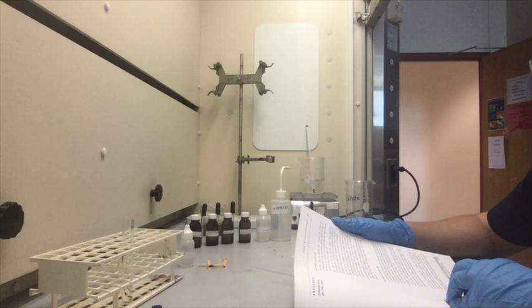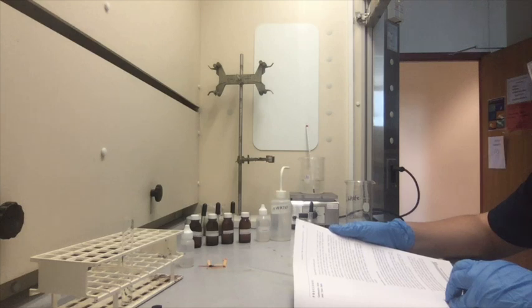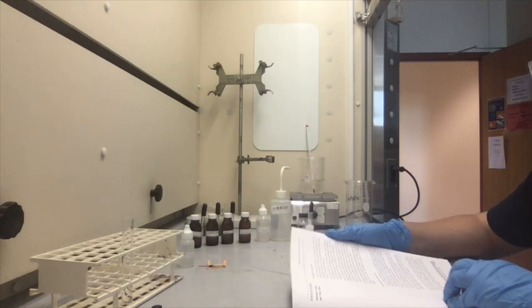Your instructor will measure out 0.1 grams of benzoic acid for sample size comparison. With your micro spatula, place some sample equivalent to the pre-weighed sample. An exact quantity is not important here. Add the solution to the test tube along with 2 mL of water.